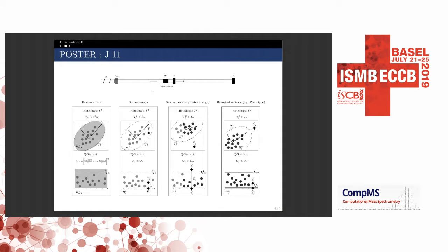So what we do is actually order the chromatograms in the injection order of the equipment, and then, through a sliding window, characterize sample by sample in a quantitative and qualitative way to depict what are the problems and the events present in the data set. Let me give you an example about that.